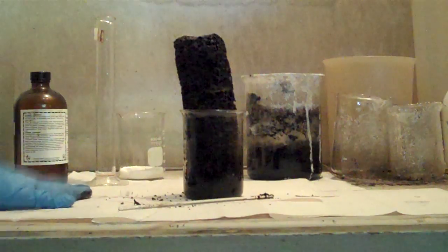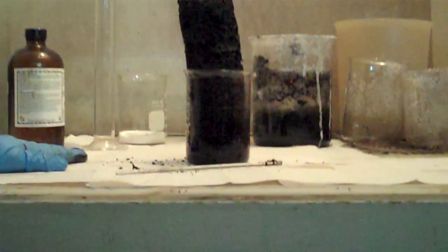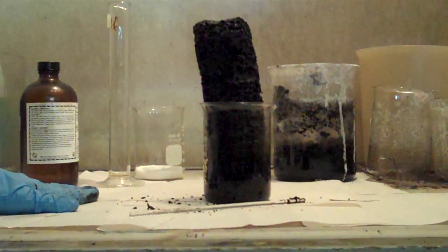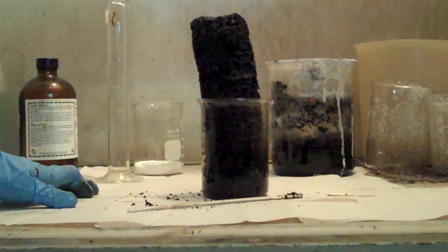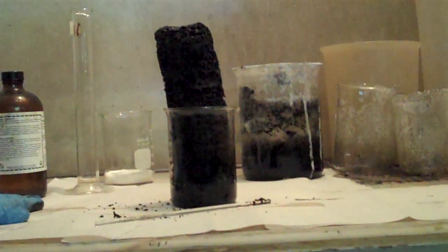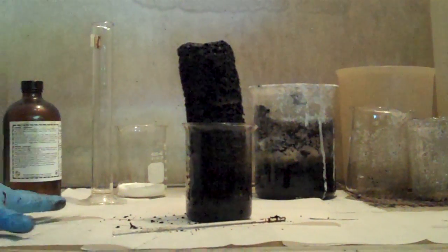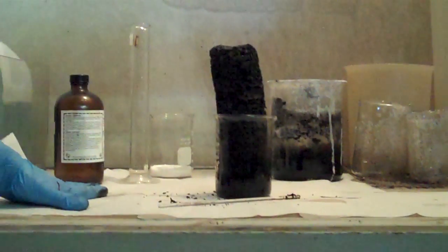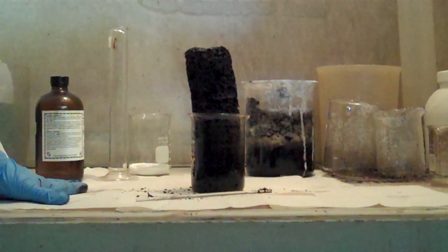But that's why I put this on the bottom, and that's why it's in the fume hood. Cool stuff. Oh, wow. I think your exit slip might have to be for homework as opposed to doing it now. So if you would all have a seat so we can hand out our exit slips. Aren't you going to put it on the baking soda?